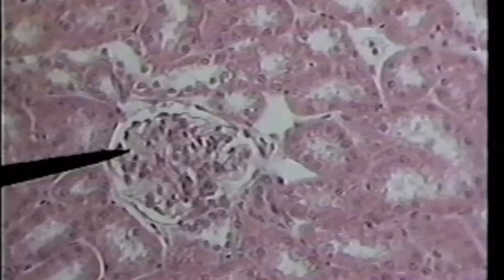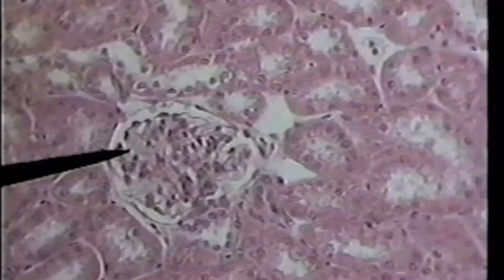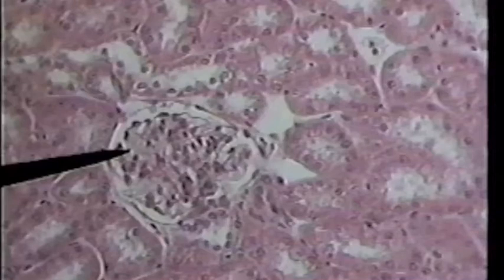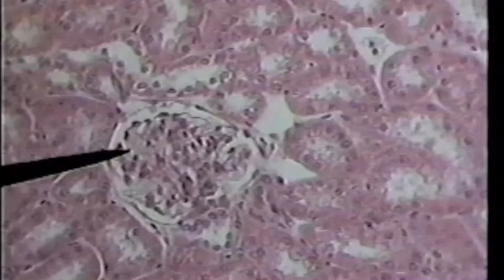What I'm interested in now, however, is the tissue surrounding the glomerulus. The tissue surrounding the glomerulus is actually a bunch of tubules that have been cut in cross-section, and most of them are transverse sections.